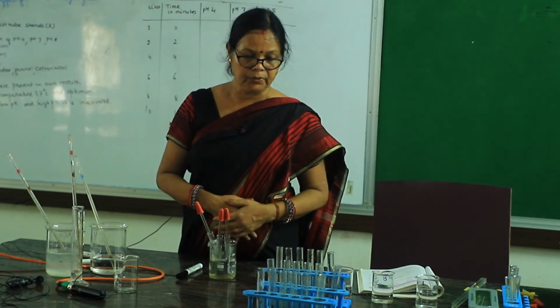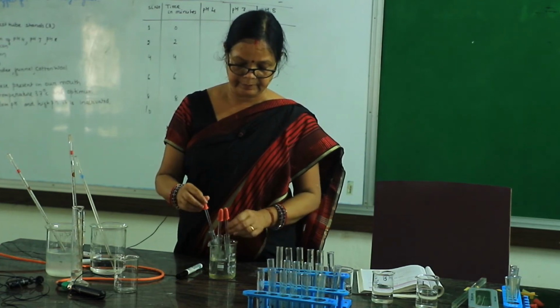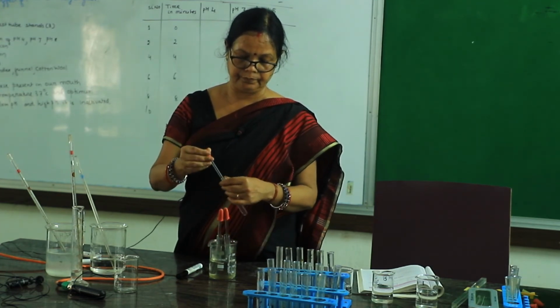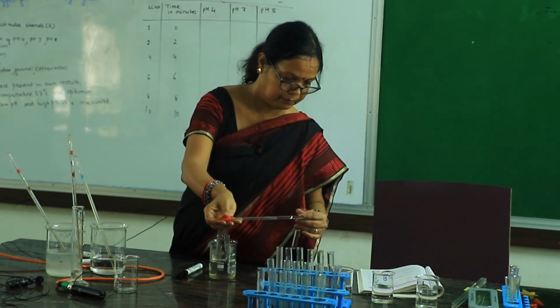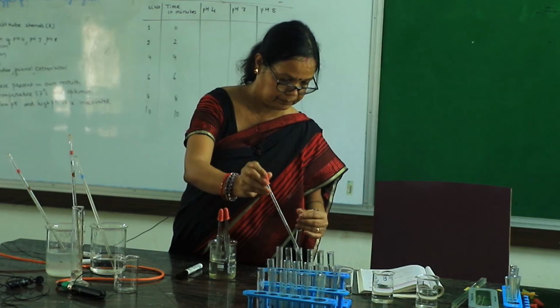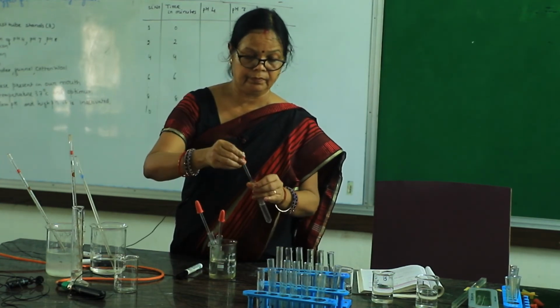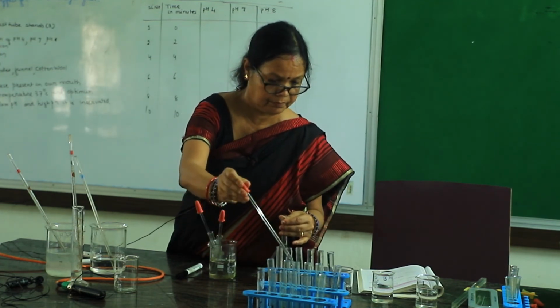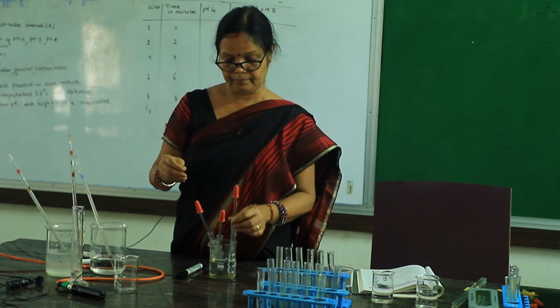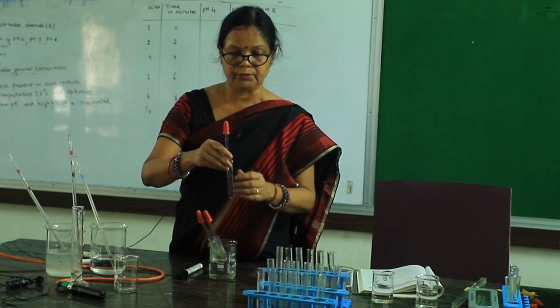Again, after a 2 minute interval, we will continue the process, and from pH 7 to the third test tube.